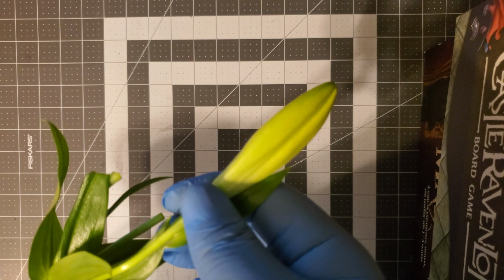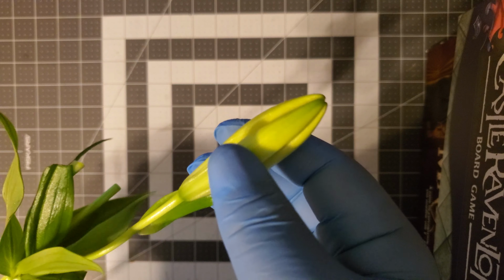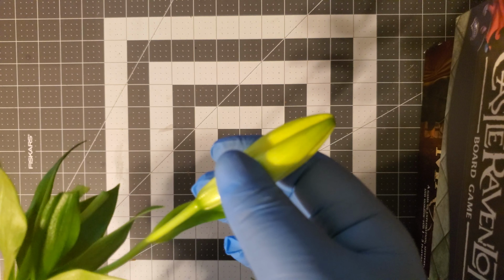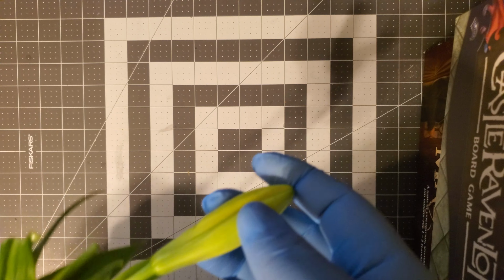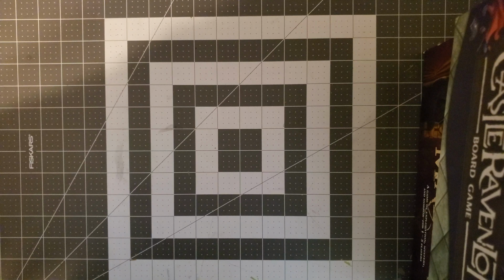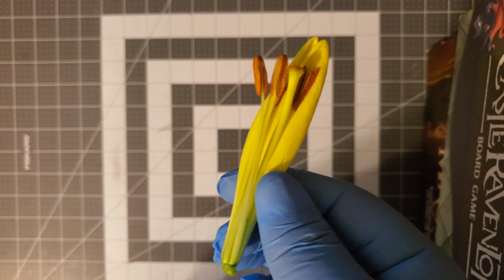So this yellow flower, I believe it's in its bud form. The sepals are quite tough. They are definitely doing their job of protecting it. So to find what's inside, I had to dissect it. And so here we go. I have another dissected part as well. Here's the sepal, and then here's the inside. I just cut it away with the X-Acto knife.